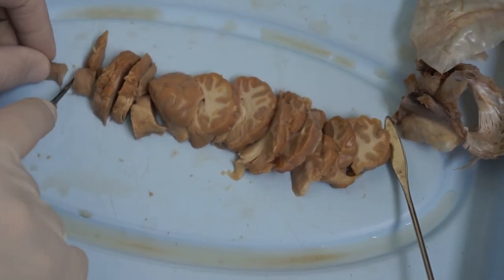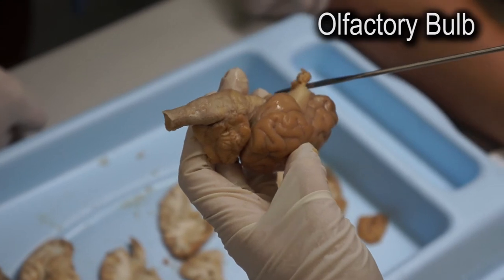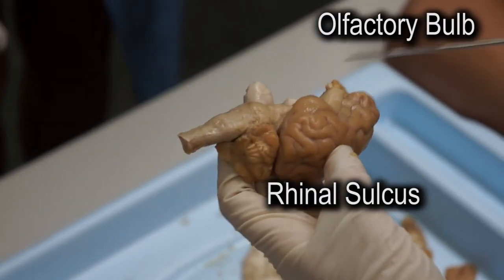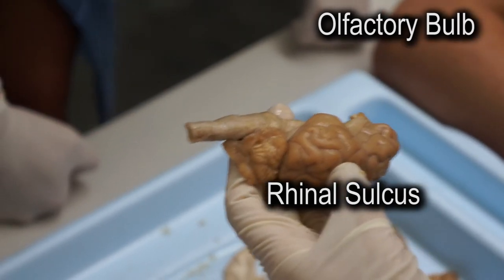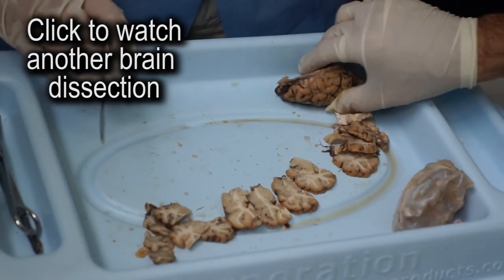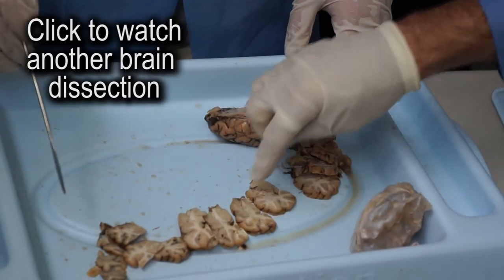Look at that brain. And what is the name of this thing here? See, you have the olfactory bulb. Rhinosulcus. Rhinosulcus — like a rhinoceros. Rhinosulcus means nose. Now, one of the things you want to find is the uncus, this bump. See, you can figure out where the bump is as we go back here.